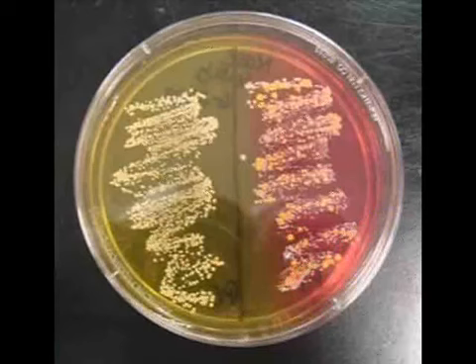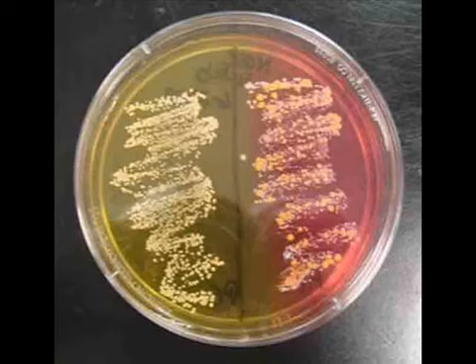Here's a nasal sample plate prepared by a pair of lab partners. The sample on the left indicates pathogen Staphylococcus aureus, a halophile that will grow on mannitol salt agar and ferment mannitol, triggering that pH-sensitive dye to change color. The sample on the right indicates Staphylococcus epidermidis, which is normal flora, that is halophilic. It will grow on mannitol salt agar, but does not ferment mannitol, so there is no change in the color of the agar.